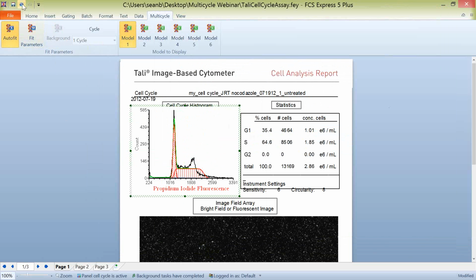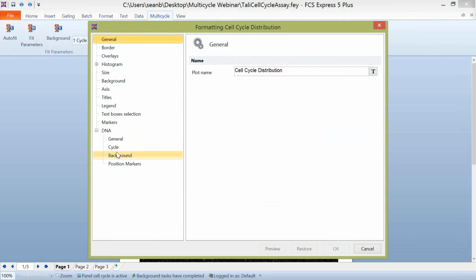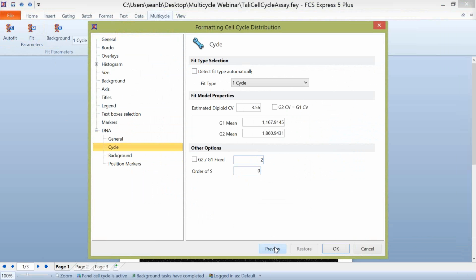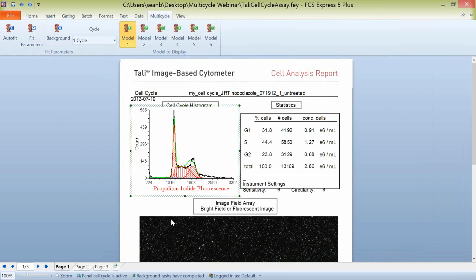So again, the way that that's changed is that you would come in here to your formatting tab, and instead of using the value of somewhere around 2, which is what Multicycle would determine, you would enter a fixed value here, and we would check that box, use 1.6, and now our data is being fitted appropriately to what the data looks like. We're still taking into account a reasonable CV. We still know it's one cycle data. We have our G1 and G2 means, which look acceptable, and we actually review that with the data. But we just know with this particular data set, the spread between these G1 and G2 populations wasn't as much as would be expected. So again, that's a change that you can come in and make if you'd like to use that as well.